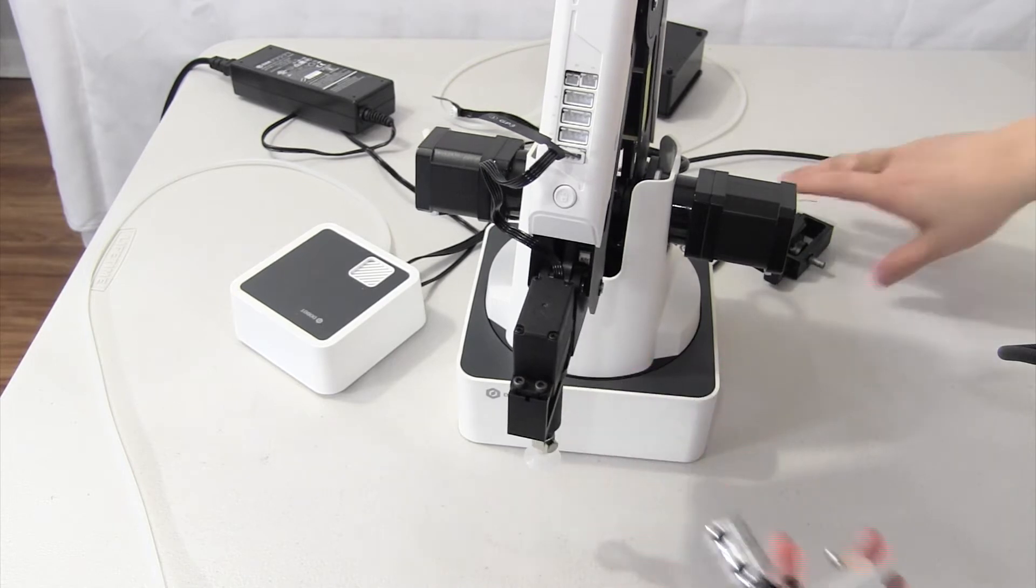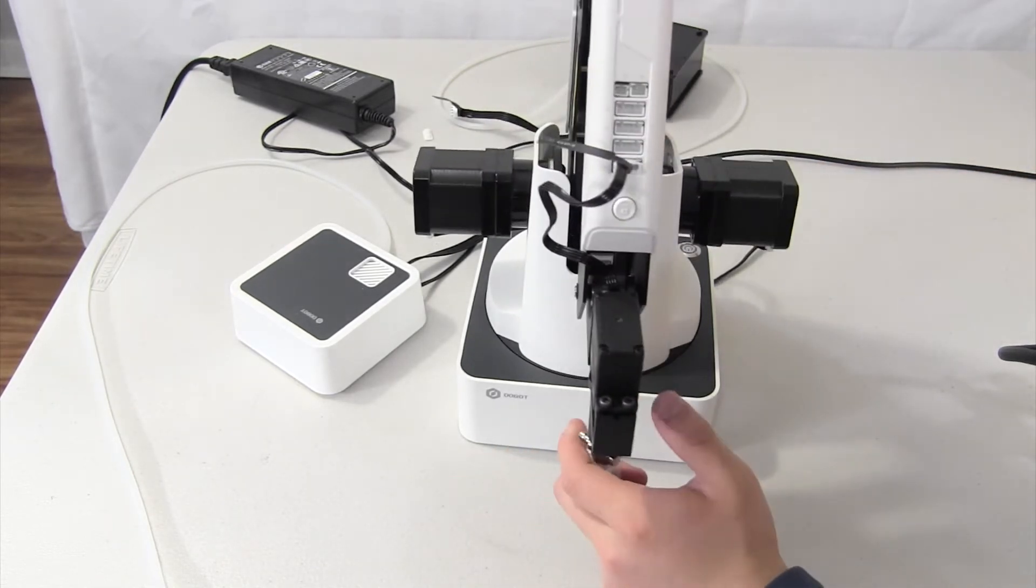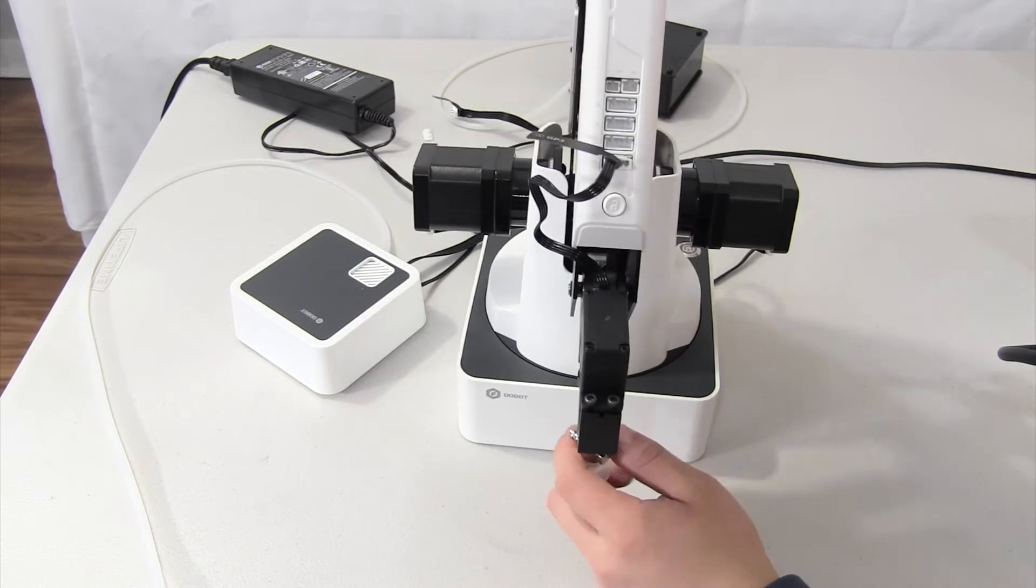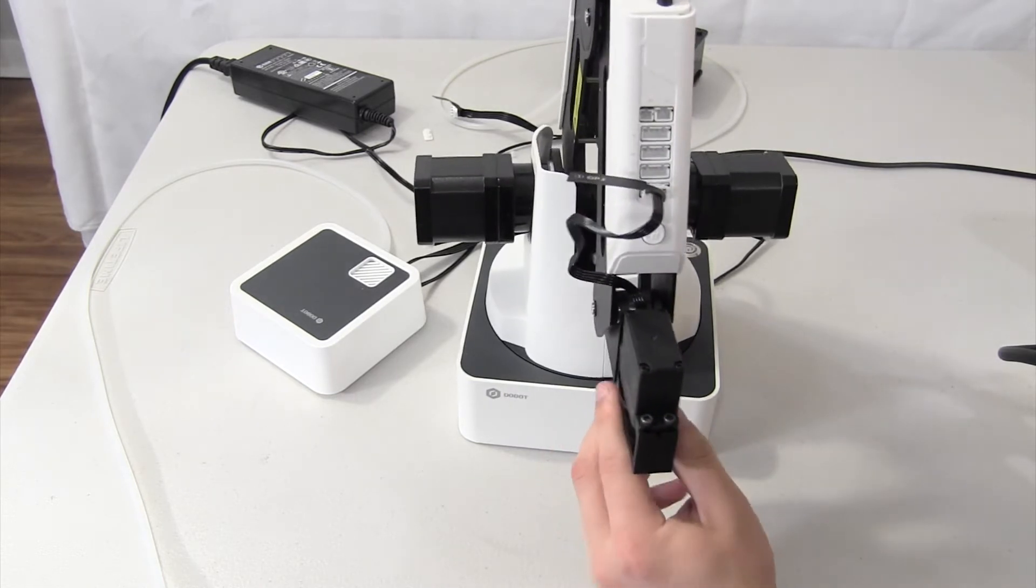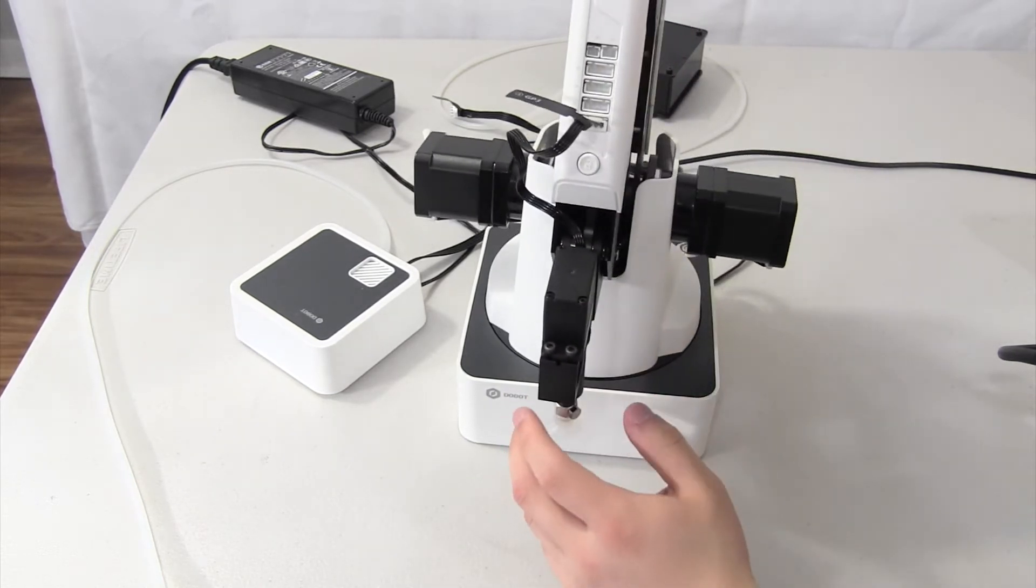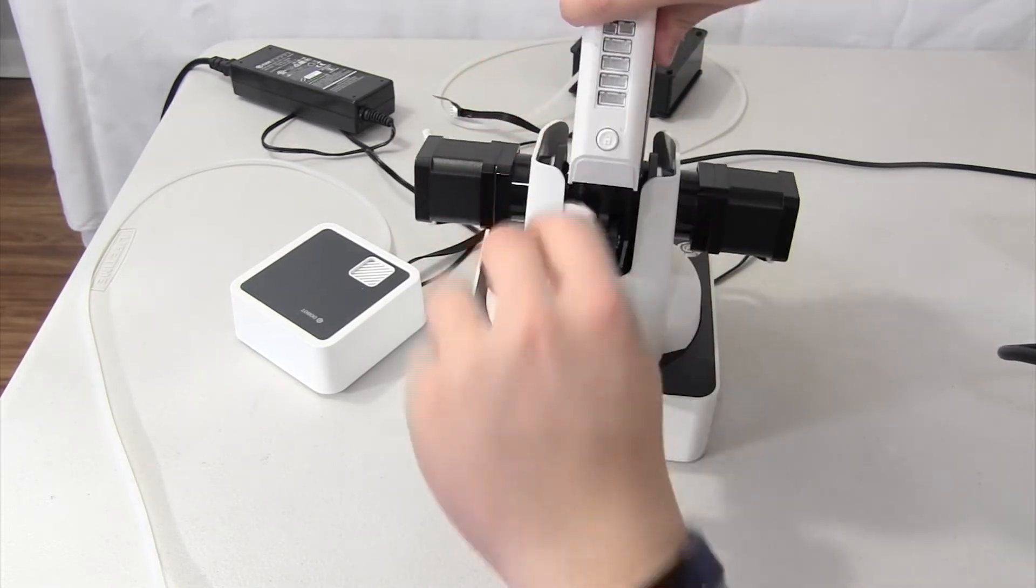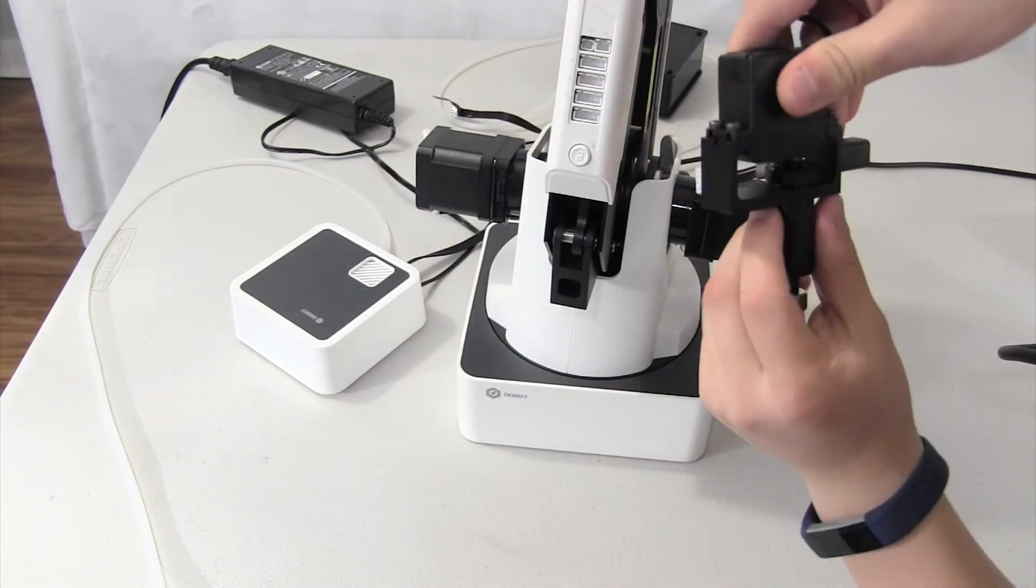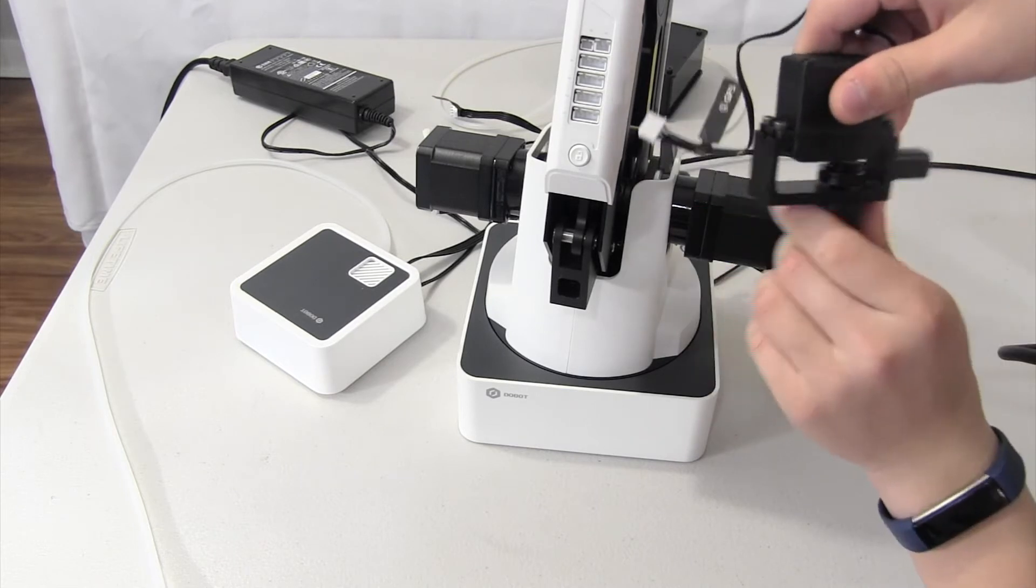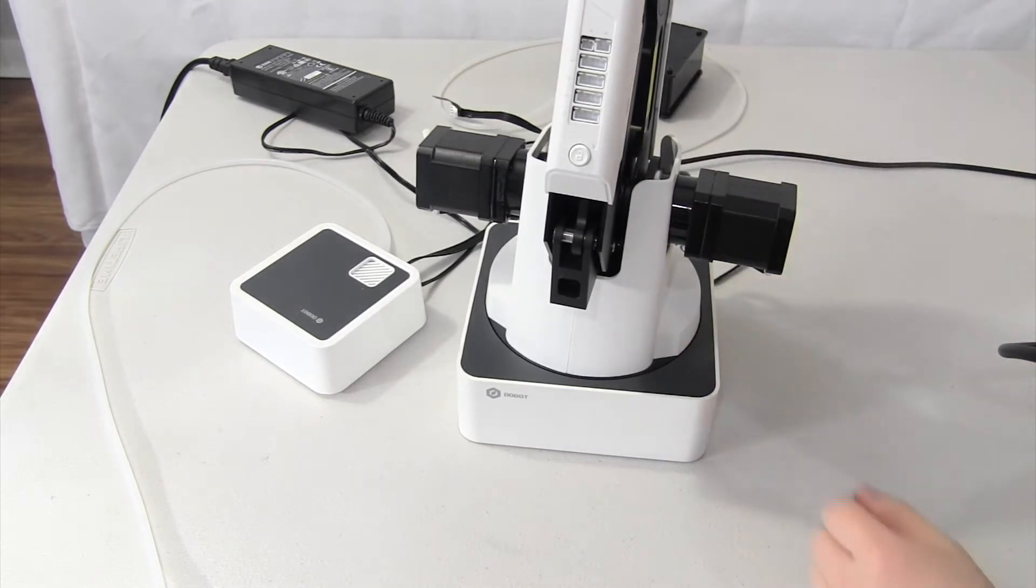Something like this. Now, first of all, you're going to have to get out your suction cup from the previous video and you'll have to take off the suction module. In my case, I will be taking off my suction module and you'll pretty much be taking off this part and then putting on the gripper.